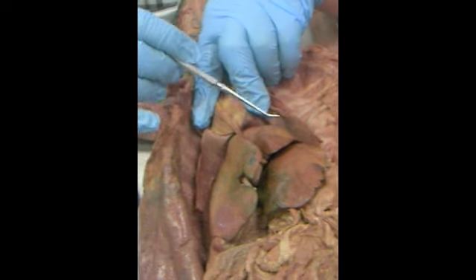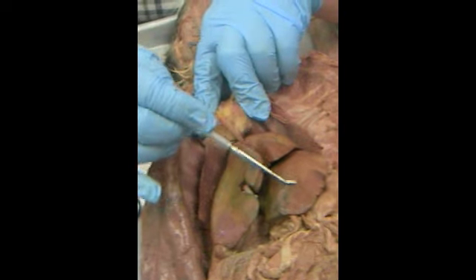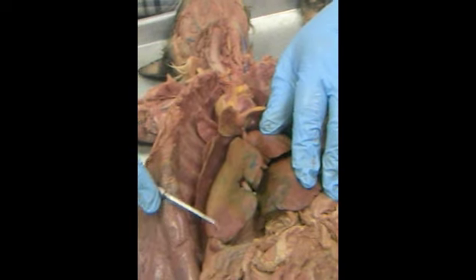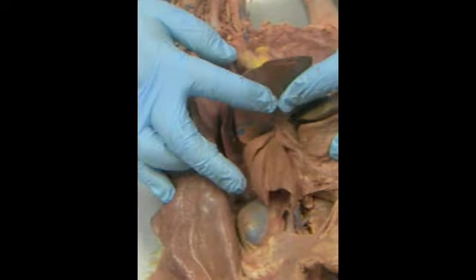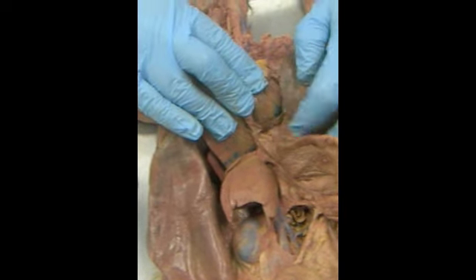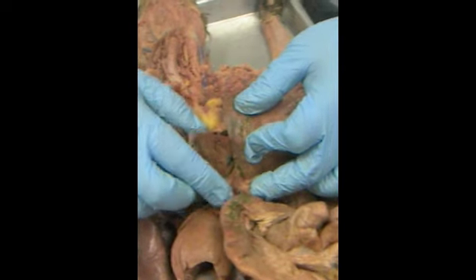The liver has 5 lobes: the left medial, the left lateral. This large C-shaped one is the right medial. Over here is the right lateral. Right in the middle, right there, near the stomach, would be the caudate, or little tail.